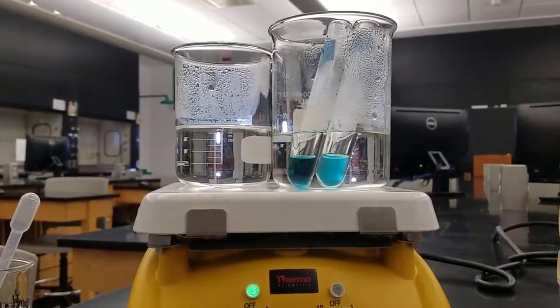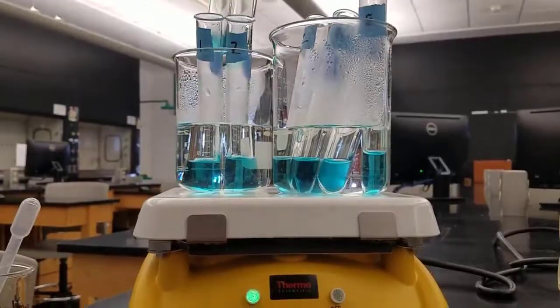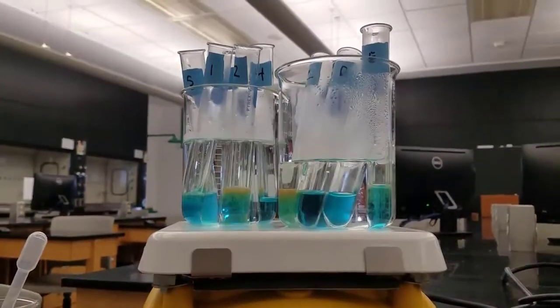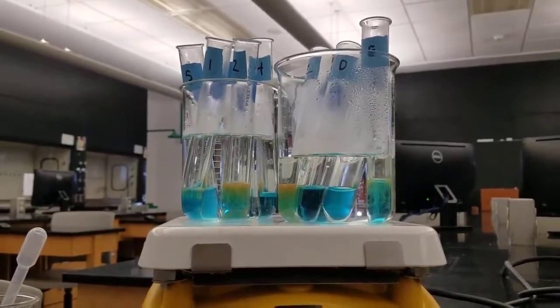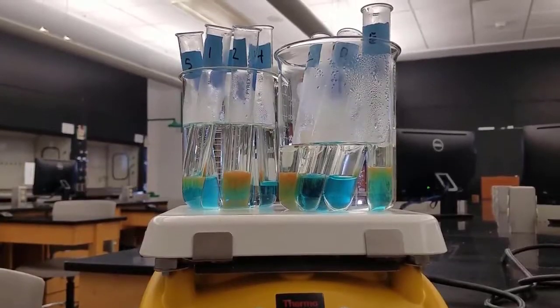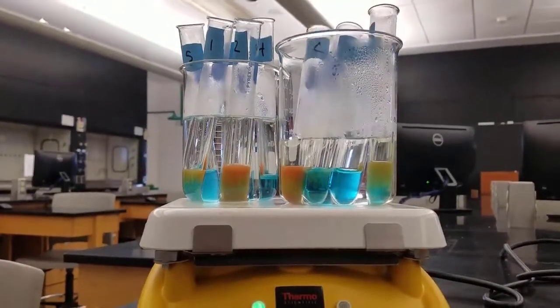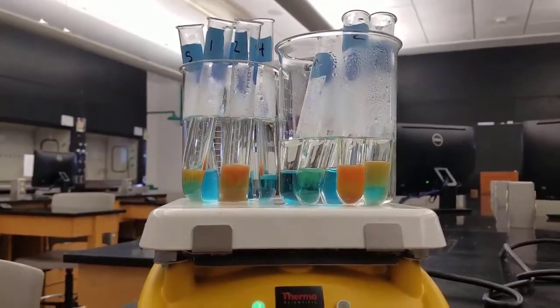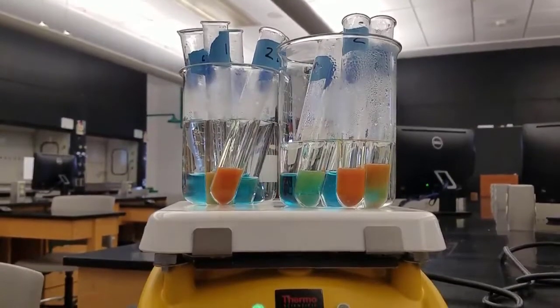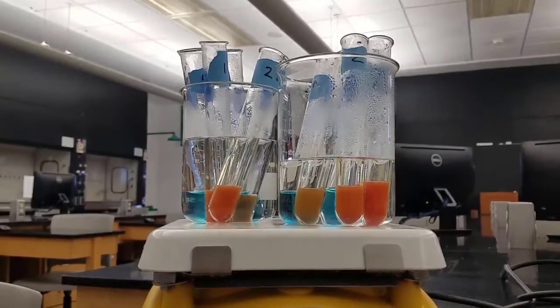We heat the test tubes in the boiling water bath for five minutes. This time we're looking for a reddish solid to form — that indicates a lot of sugar. Less sugar will produce green or yellow solids. The ones staying blue and transparent show no reaction. You can see yellow solids forming and becoming orange in some test tubes. The solid makes the solution opaque — if you can't see through it, there's a solid present. Colors get darker with more heat.